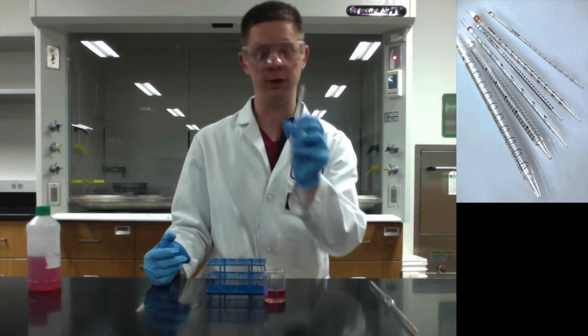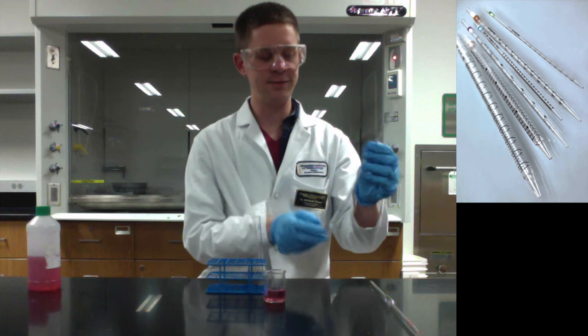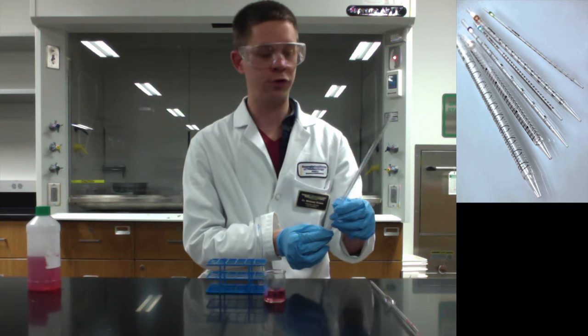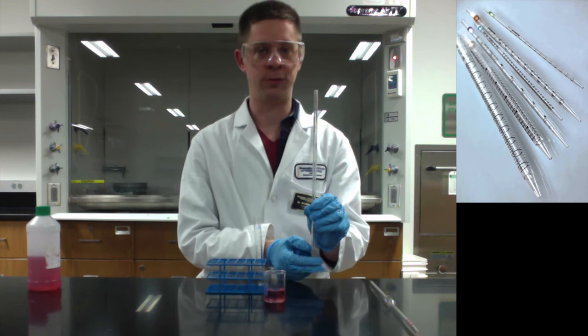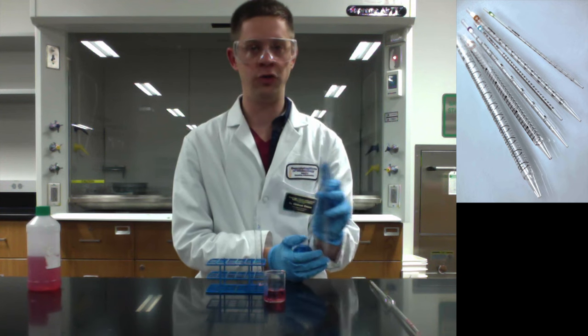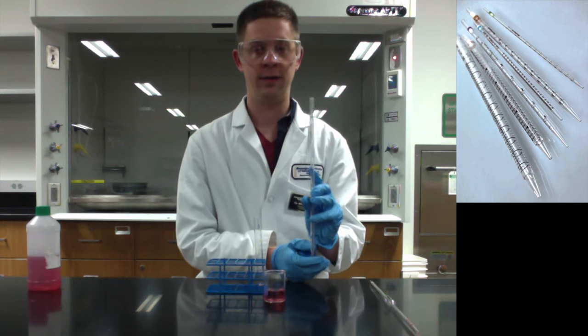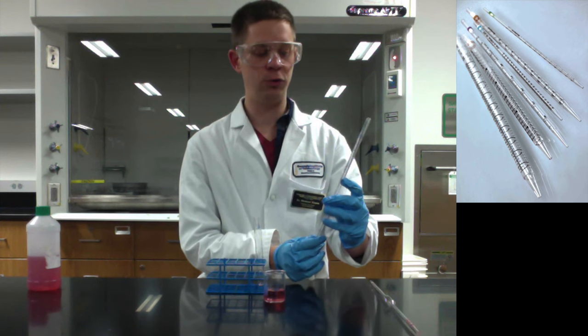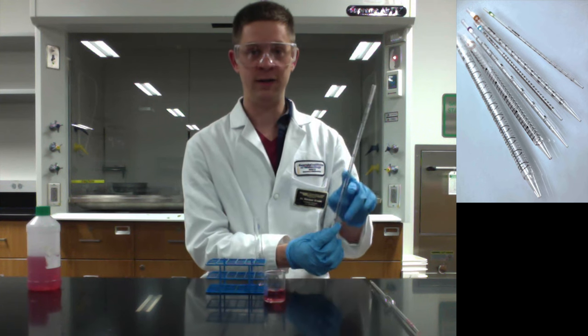So how do we go about doing this? Well, the first thing before you even dip the pipette in, identify visually where you're trying to go on the serological pipette. If you're being really careful about serological technique, actually, the easiest thing to do is fill to the zero line. Fill to the zero line and then use your finger to deliver downward.